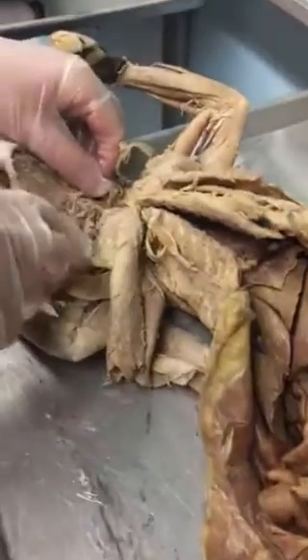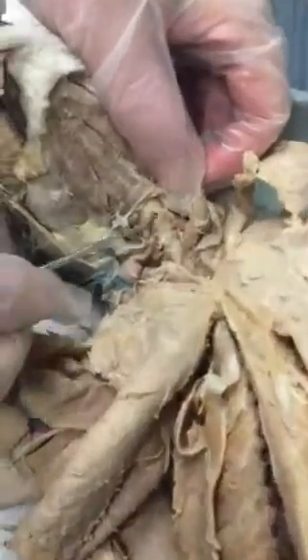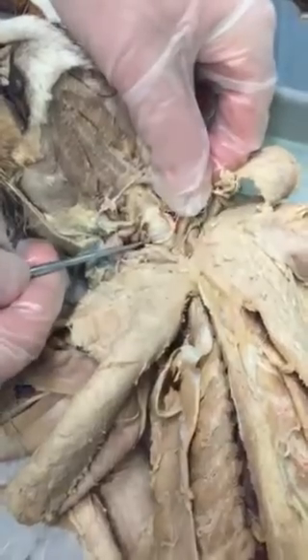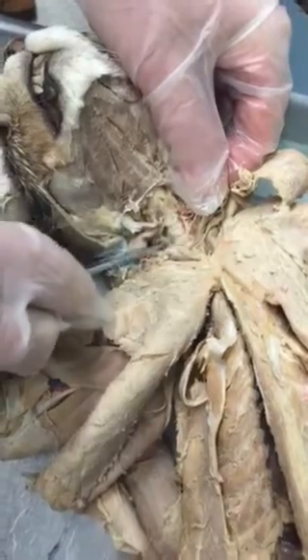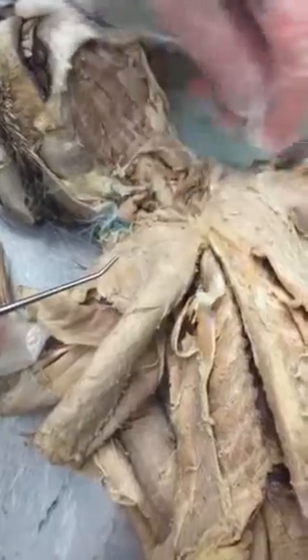First of all, in the neck region, you have the larynx, the Adam's apple, right, or the voice box. Underneath it here is the trachea. You can tell the trachea because it has distinct rings, right? It looks like a vacuum hose with rings in it. And those are the hyaline cartilage rings.